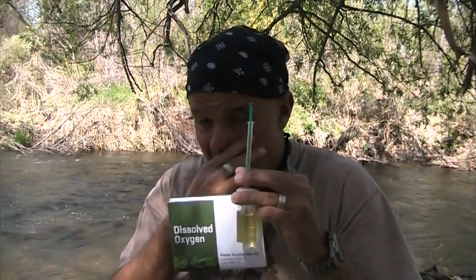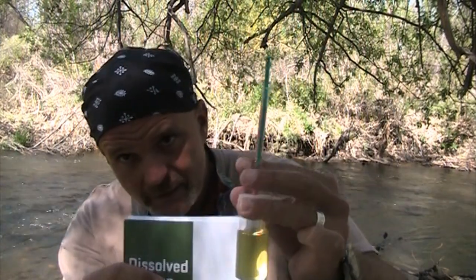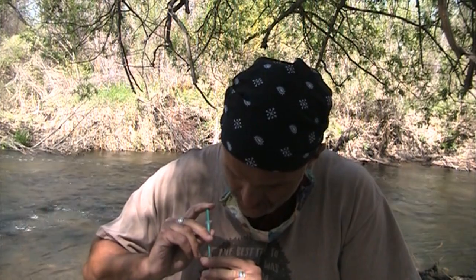So with your students, and for those of you who are AP teachers, normally this isn't this fast. This is because I'm a total nerd who spent way too much time doing this. But I've achieved, it's kind of a Chardonnay, and I want more of a Pinot Grigio. If it looks like Pinot Noir, you've done something horribly wrong. So there we are at a pale yellow.